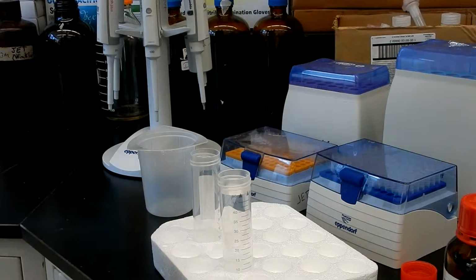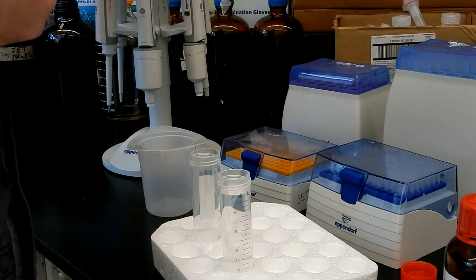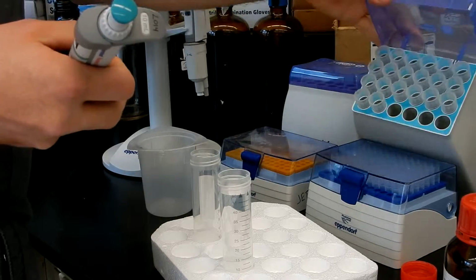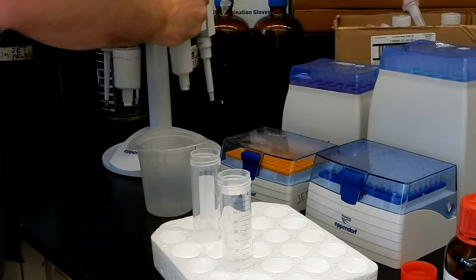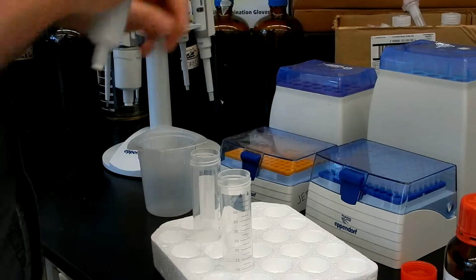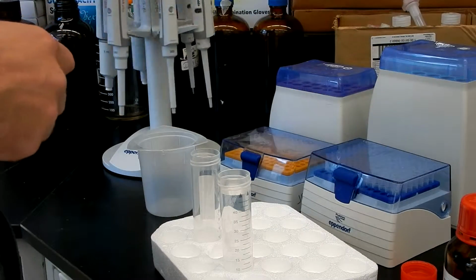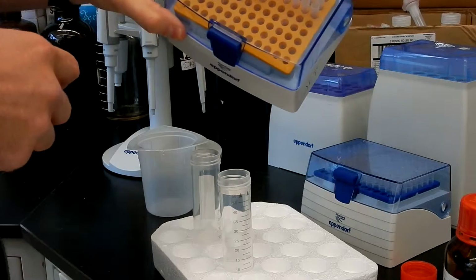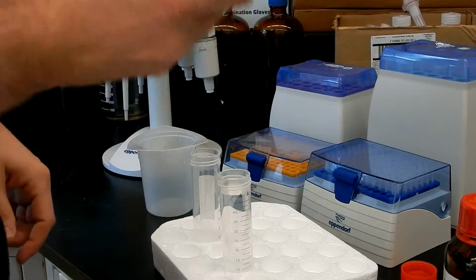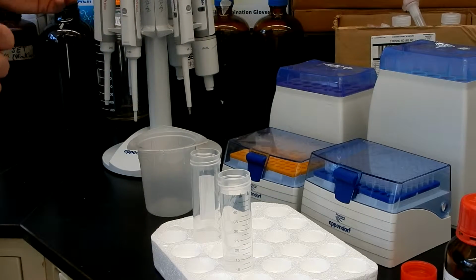First of all, I want you to notice that each of the pipettes has a color, and the color is an indicator of the tip you should use. For the 10 milliliter, you have the turquoise here. Same thing for the tips. Purple or violet for the 5 milliliters, the blue for the 1 milliliter, and you have the 2 yellows, these tips. I don't have the tips for the gray 10 microliters. I have them over there. So I'm going to show you how to identify them.